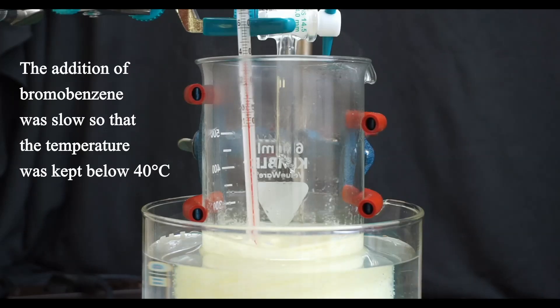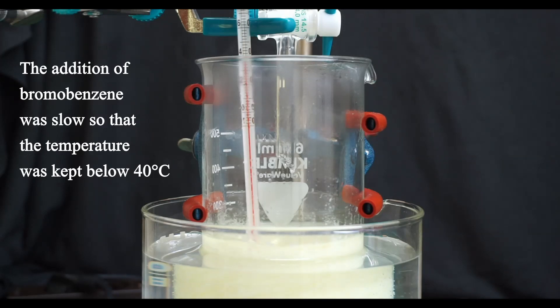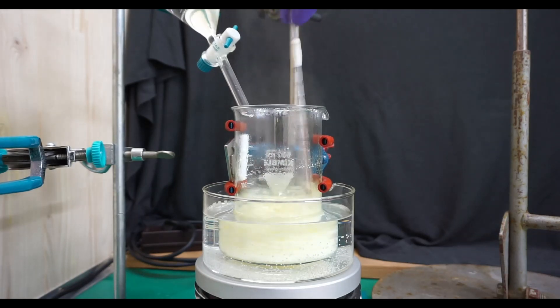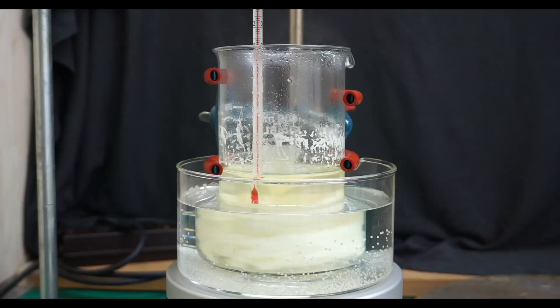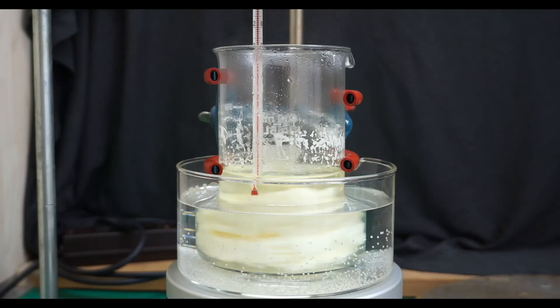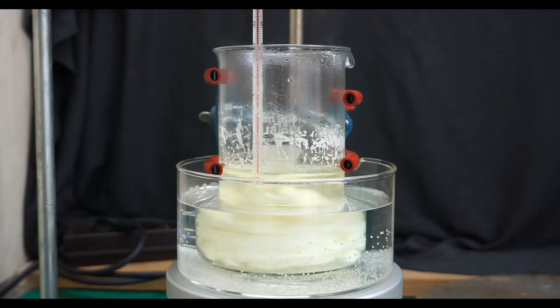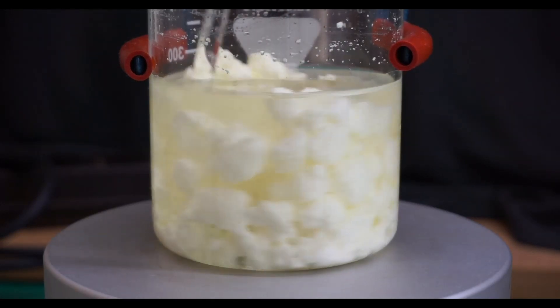However, soon the magnetic stirrer was overwhelmed and could no longer stir the mixture. At this point I still had a lot of bromobenzene to add. As I don't have an overhead stirrer, I proceeded to stir the reaction mixture by hand and added the remainder of the bromobenzene. After the addition was complete, the reaction mixture was again stirrable, but this is because the unreacted bromobenzene formed a second oily layer. I continued stirring the mixture at a temperature of 42 to 48 degrees Celsius for one more hour. During this time, the oily layer solidified and magnetic stirring again became impossible.